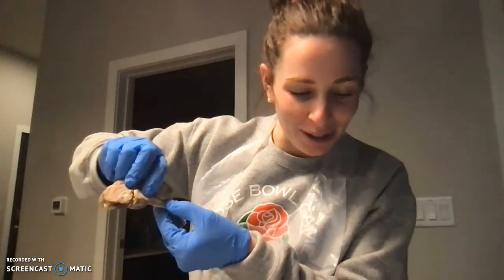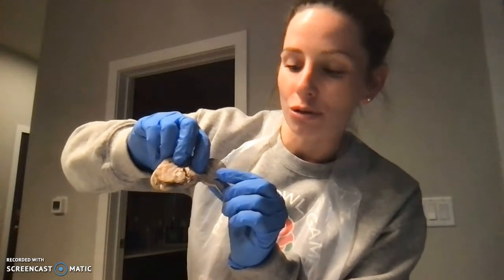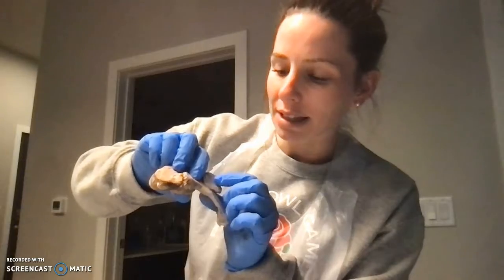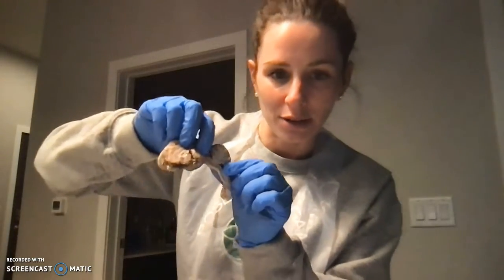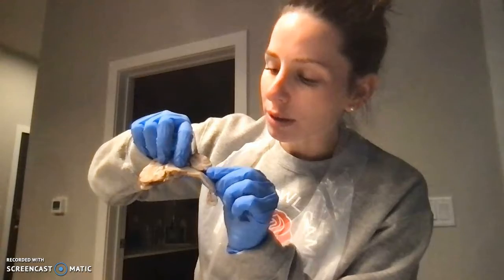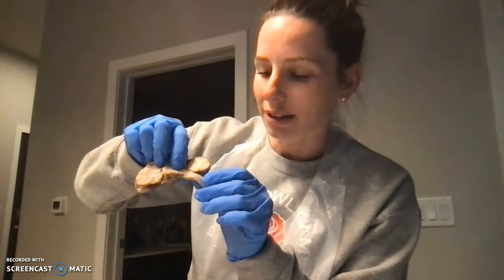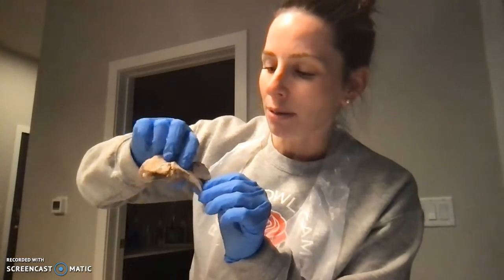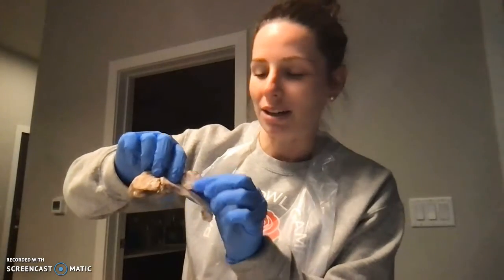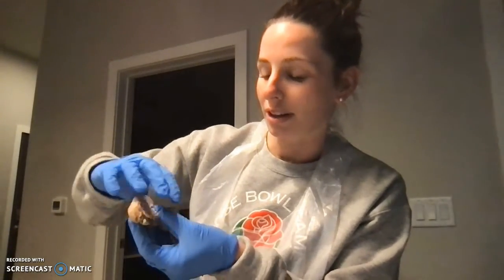So we have the medulla oblongata. And then if you look in this awesome structure here that looks like a tree called the arbor vitae, you can see this white matter in here. And I know it's hard to see on my computer and awkward to figure out which way I'm showing. But this white matter in here, it looks like a tree. And so I think that's just really interesting. And when I first made this sagittal cut into the brain and saw that, that was pretty cool.